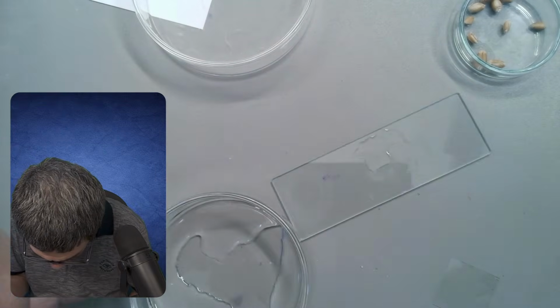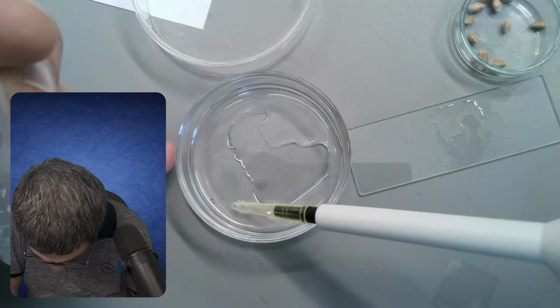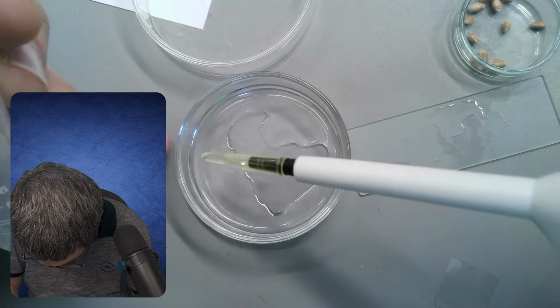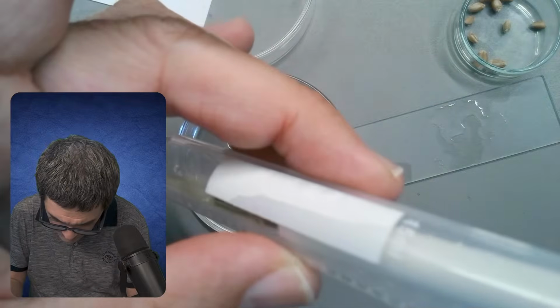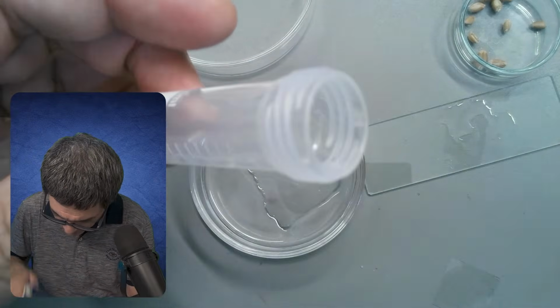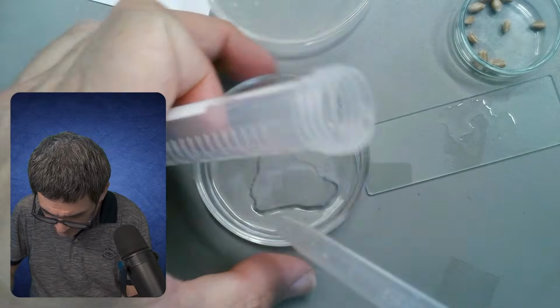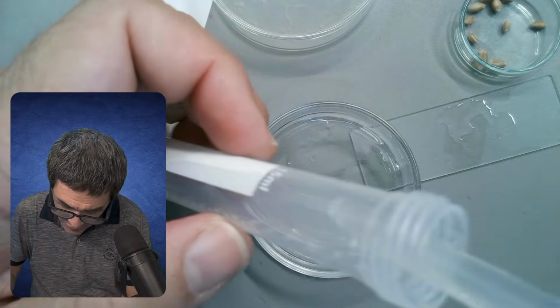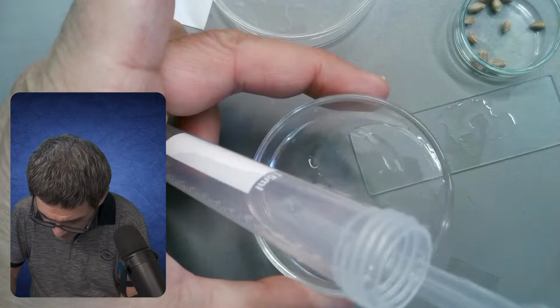There is another one, appears to be over here. It looks almost like a larva. Another larva, or here as well. And the rest I'm just going to also... I generally like to use the same water and not tap water, for the osmotic balance, of course.